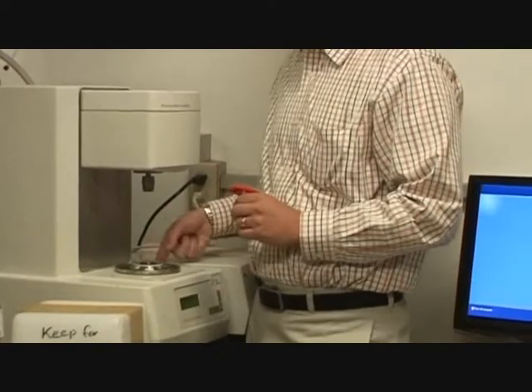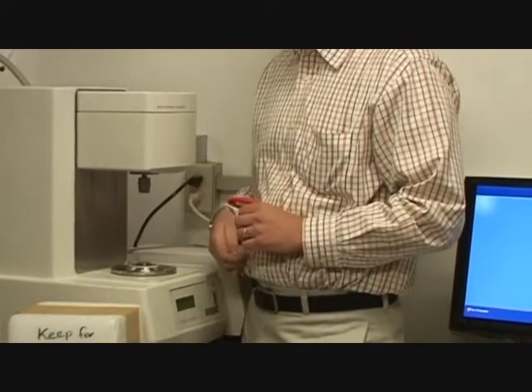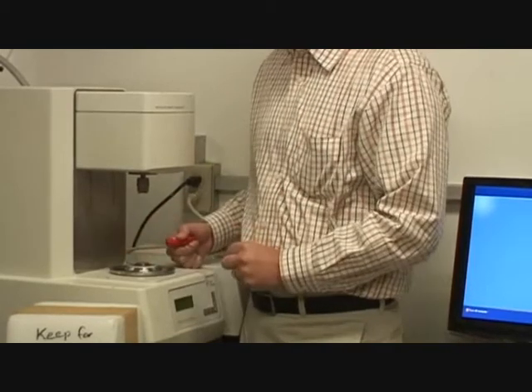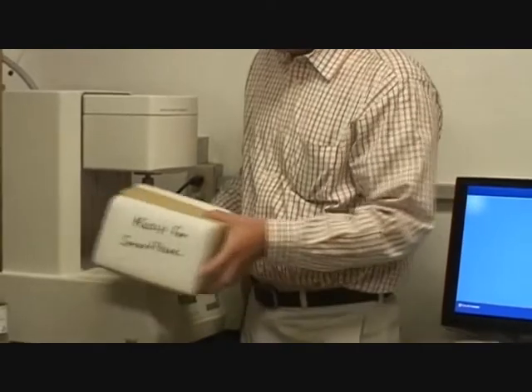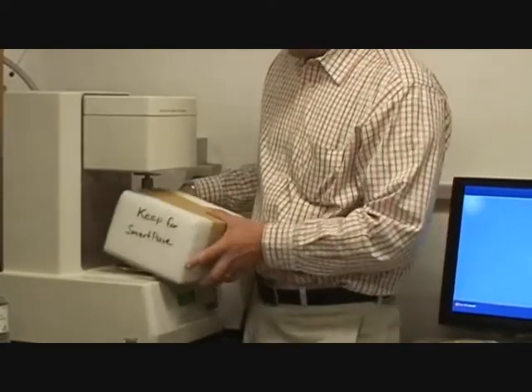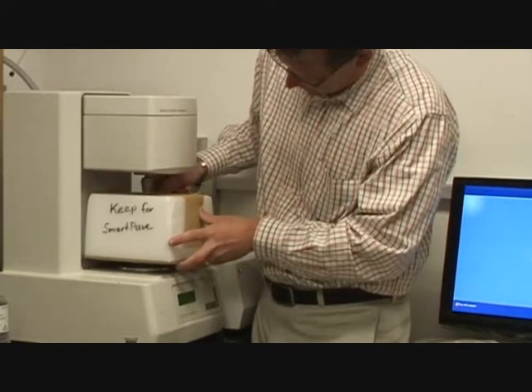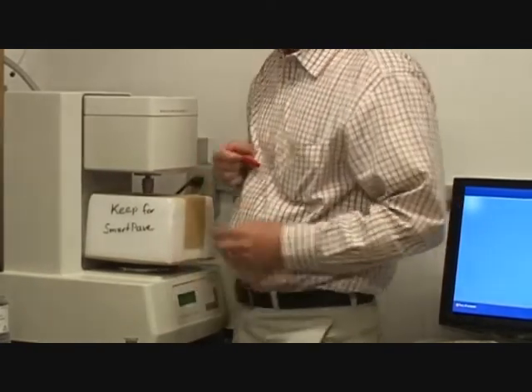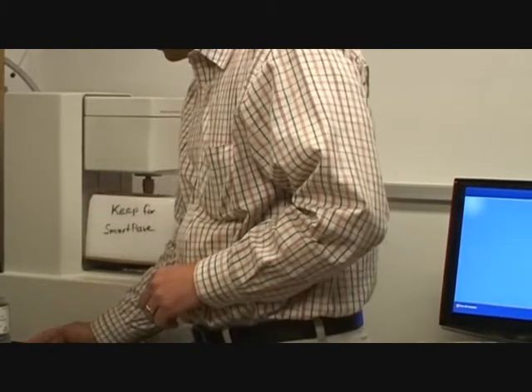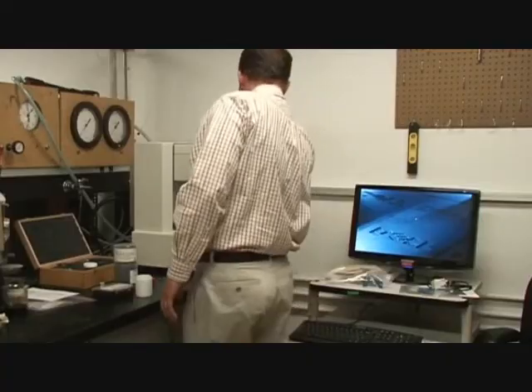You also have to get access. There's a little side door over here. Take the access off, and you can disconnect some lines in there. Then this whole Peltier plate can come off. If you notice, then this will sit flat across the board. Right now, it's not really going to sit flat. It's going to be up a little bit. This will still work to show how to protect it. But I'm just going to show real quick.